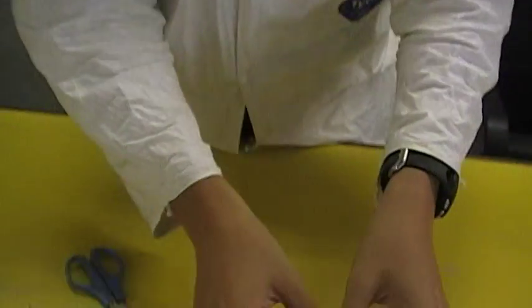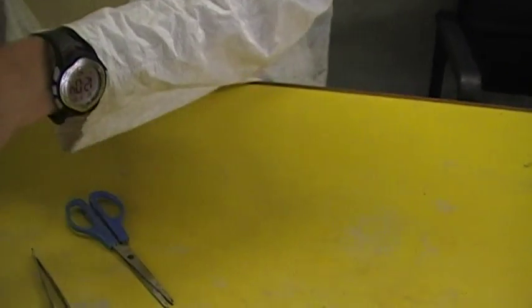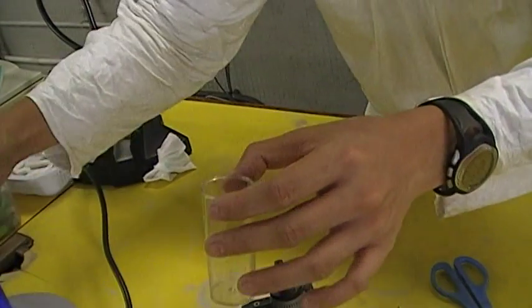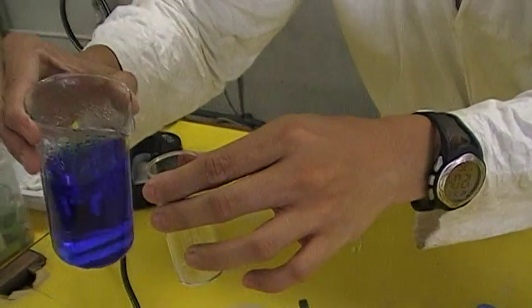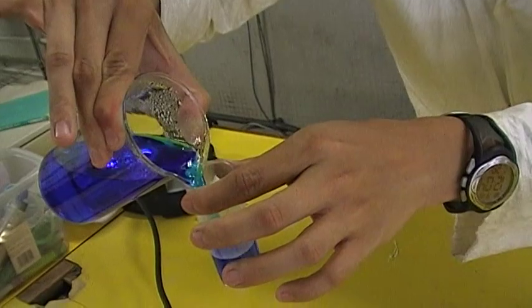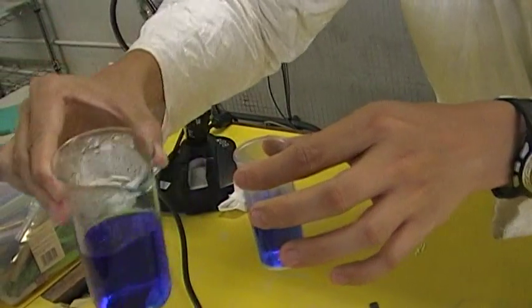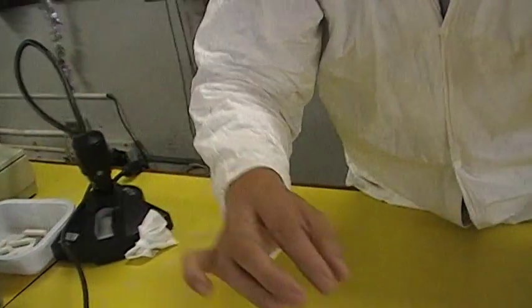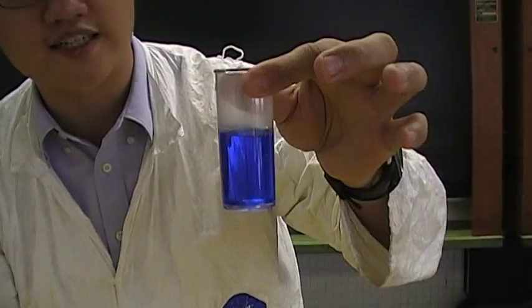Then, we will put some saturated solution into a plastic bottle. You have to make sure the solution is saturated.